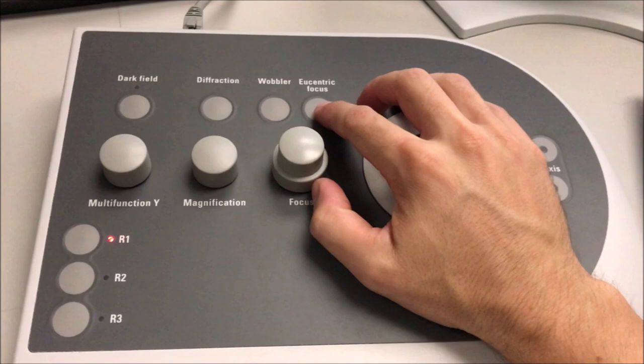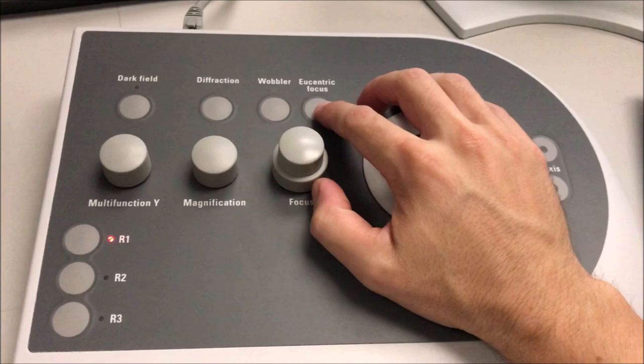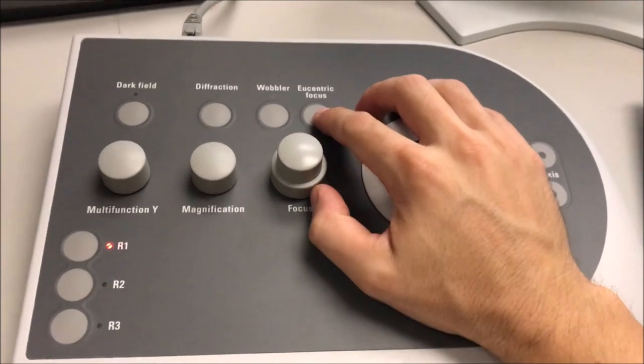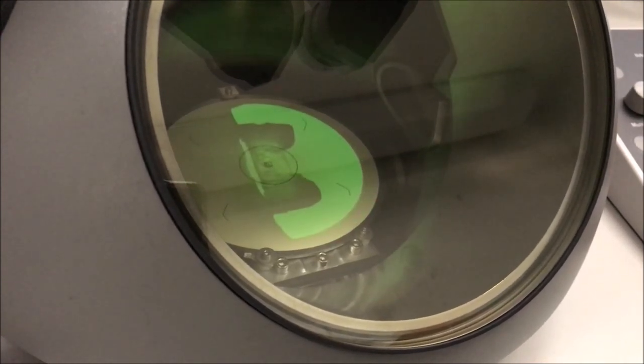The way that most people set eucentric height — and what is perhaps more convenient — is the eucentric focus method. With this method, I set my objective lens to its optimal setting and then simply adjust the z-axis buttons on my right-hand panel until I have my image in focus. To use this method, you select the eucentric focus button on your right-hand panel. The objective lens is then set to its proper setting and you use the z-axis buttons to minimize the contrast in the image. If there's any shifting of the image you can use the joystick to recenter it on the screen.